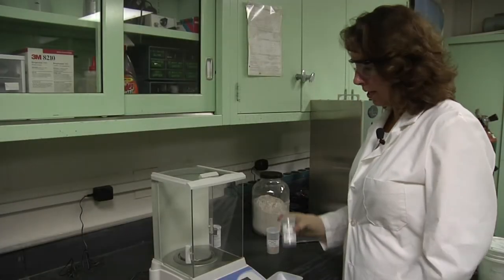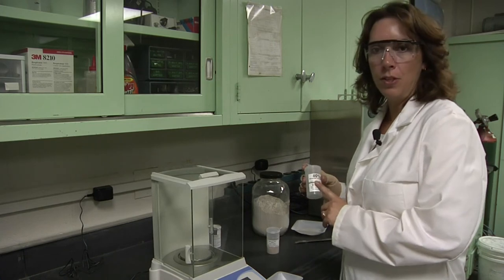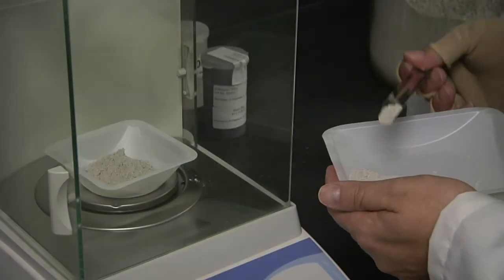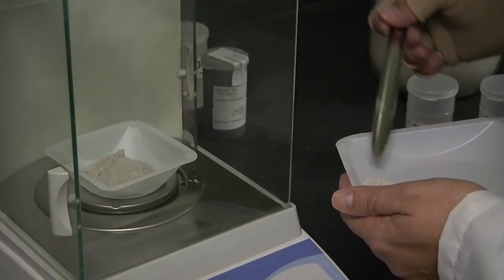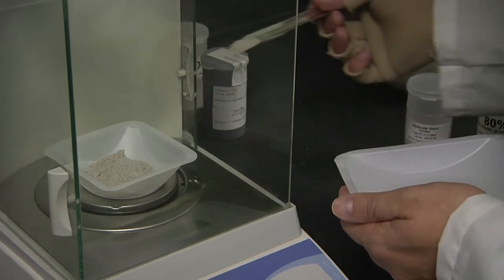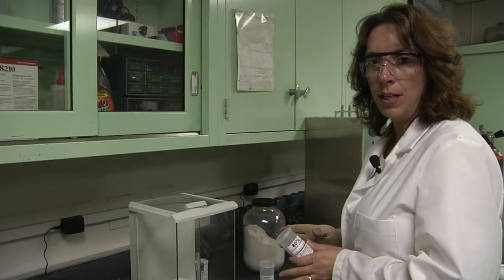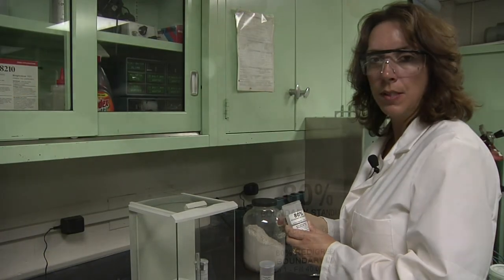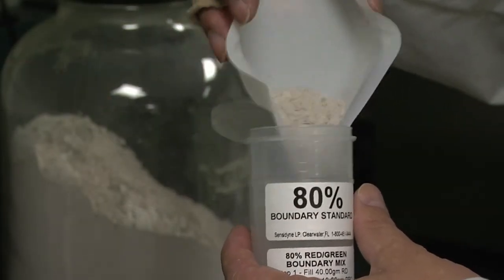To make your 80% calibration sample, you must have a balance. You need to measure out 40 grams of rock dust. Once you have your 40 grams of rock dust, add it to your 80% calibration container.